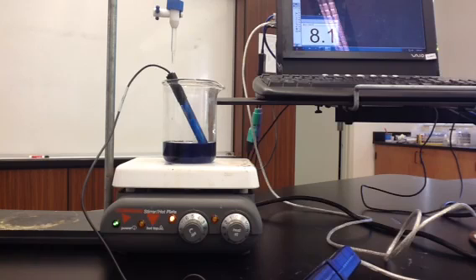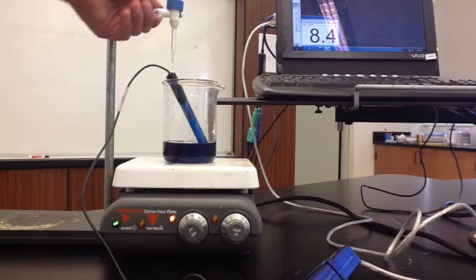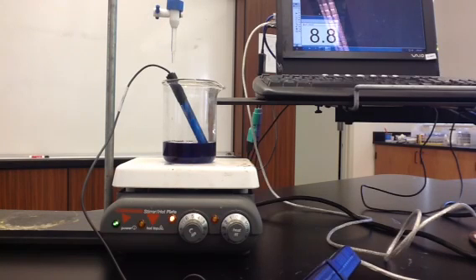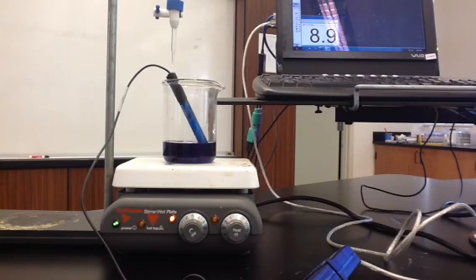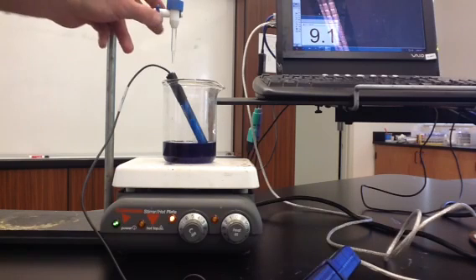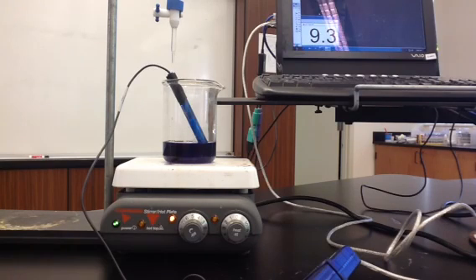That's now at 19.4 milliliters of base. At 19.8 milliliters of base, our pH is now 9. Our solution is starting to turn purple. That's 20 milliliters of base.